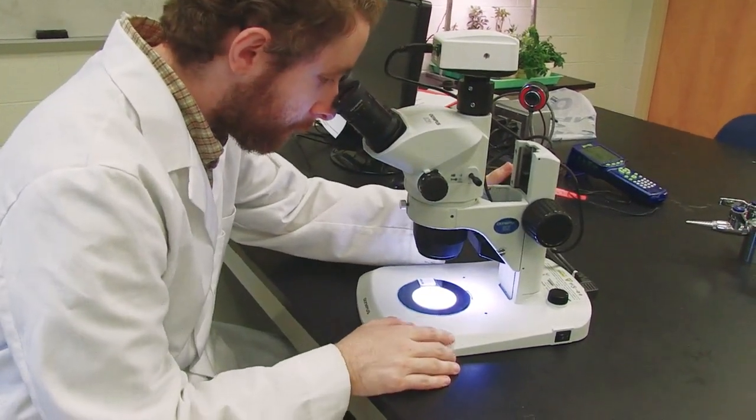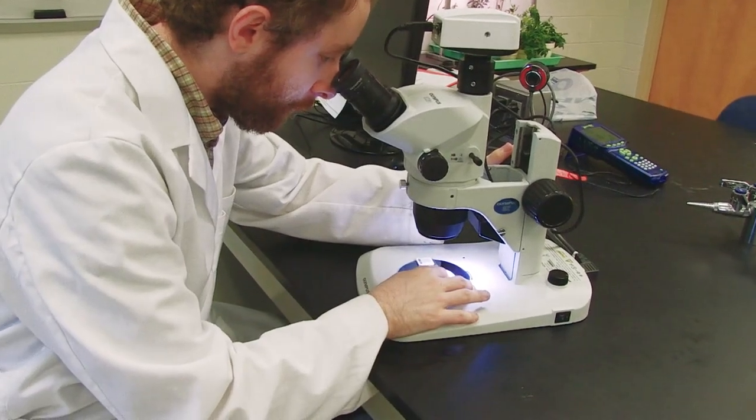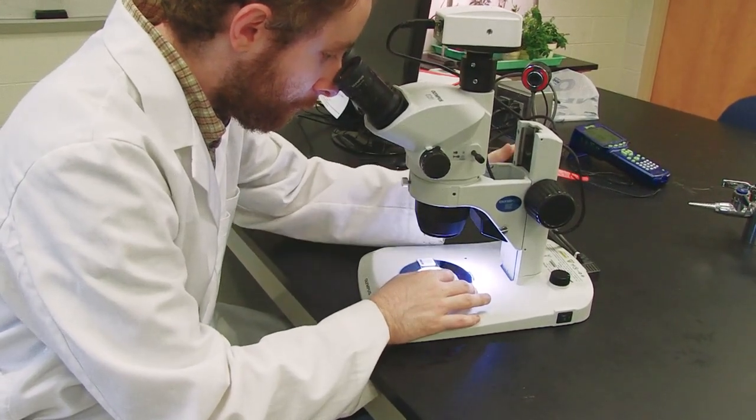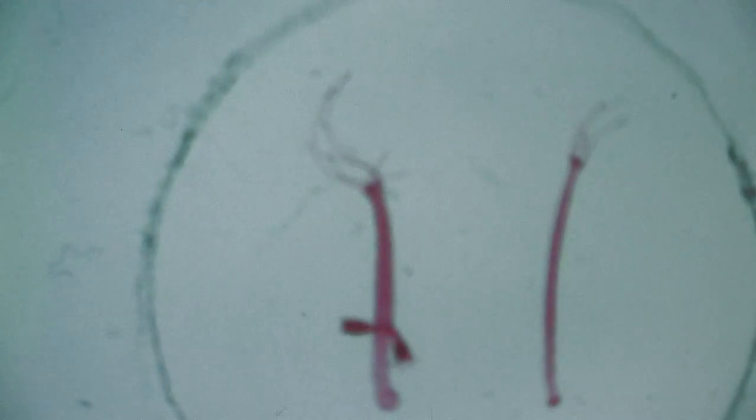While looking through the microscope, I'll begin to turn the focus knob up until you begin to see an image. And as it gets close, then just turn the knob a bit slower until it comes completely into focus.